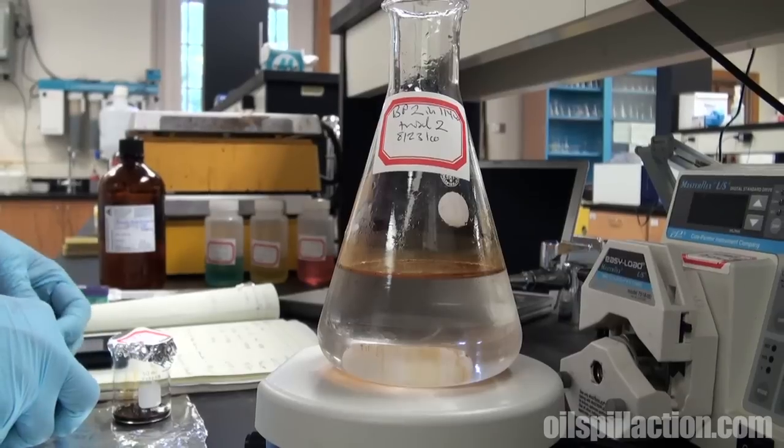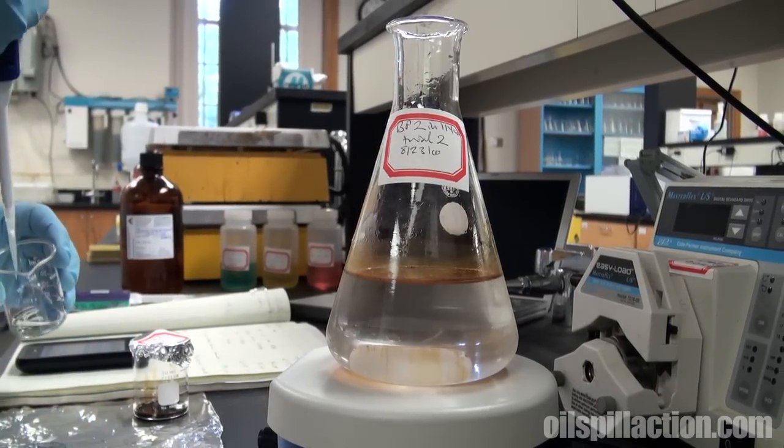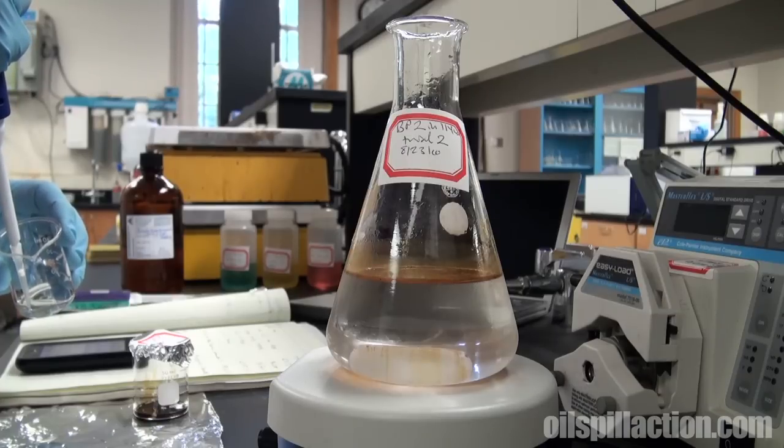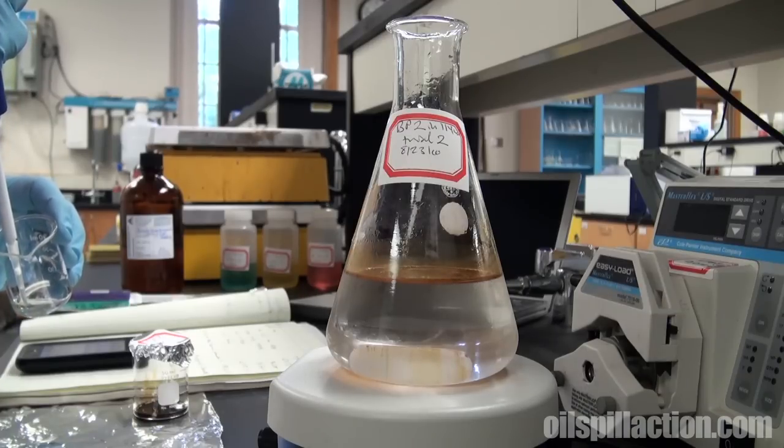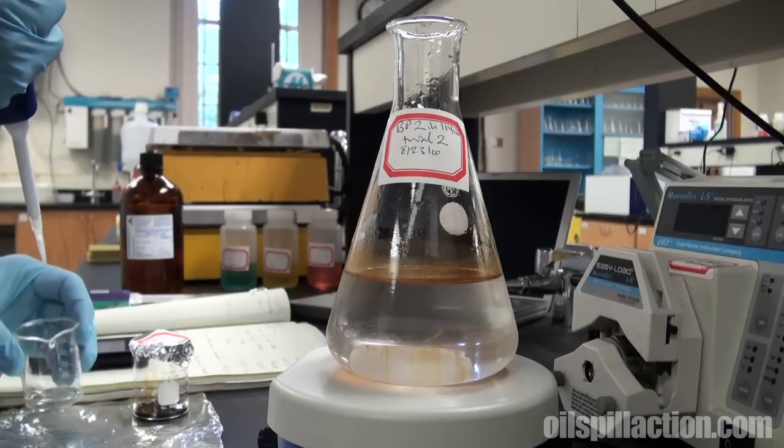This is made by Nalco. This is Corexit 9500A. We're going to add it about one part in 25 compared to the oil. That's 40 microliters, if you're keeping track.